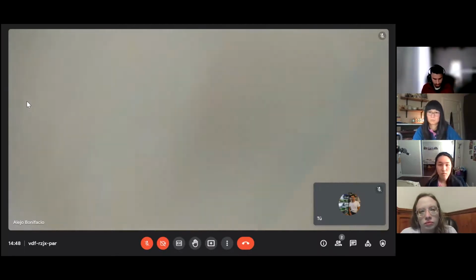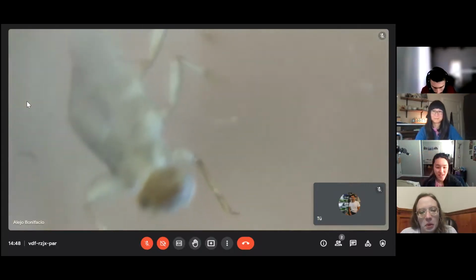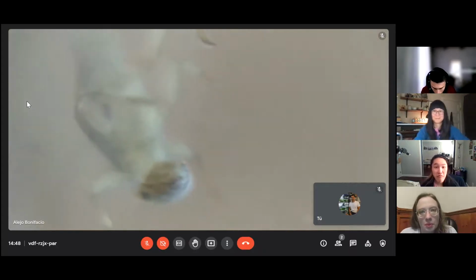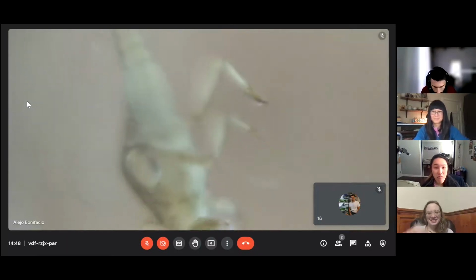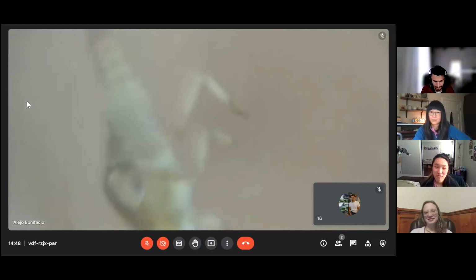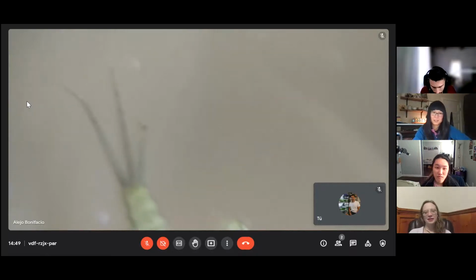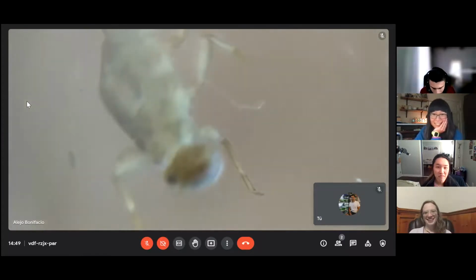But I'm going to show you how a mayfly looks. Well, they look very big. They have 4 legs right now, 5 legs, because this animal lost one when I tried to catch it. This is characteristic of mayflies. They have 3 tails, and with that they swim. With the tails. This is incredible. And that is the eye.